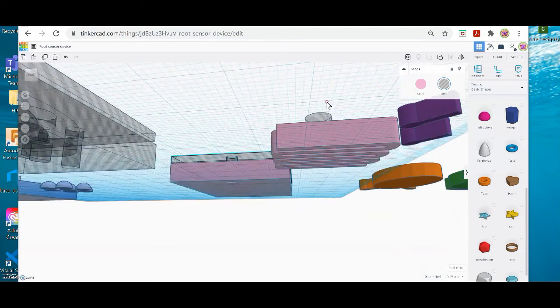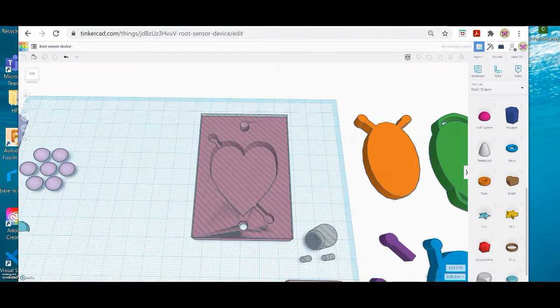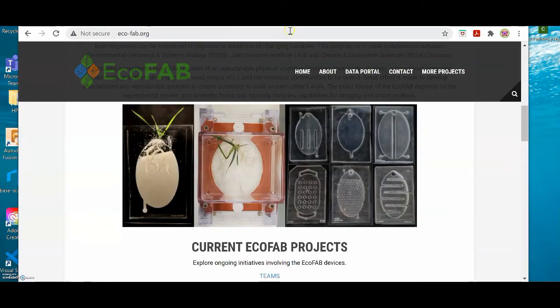But what I'd really like to do is create my port. So there's a couple things that are needed. So let's look back at the EcoFab. So every single one of theirs has at least 2 ports. This one has 1, I think. And each one has a hole to drop the seed in. We might be using peas, so we're going to make a little bit bigger hole.